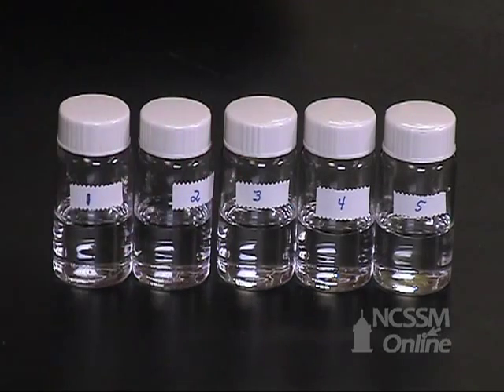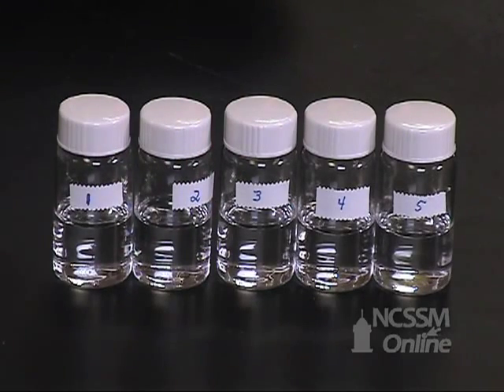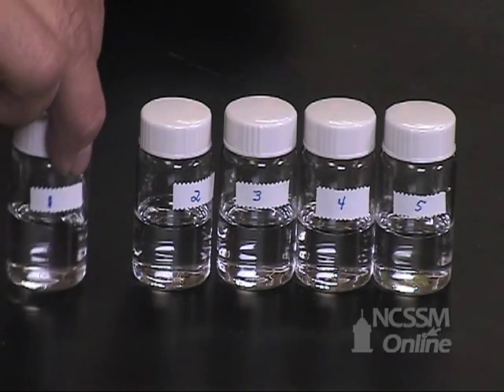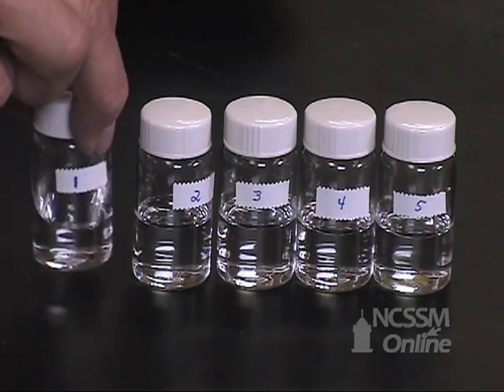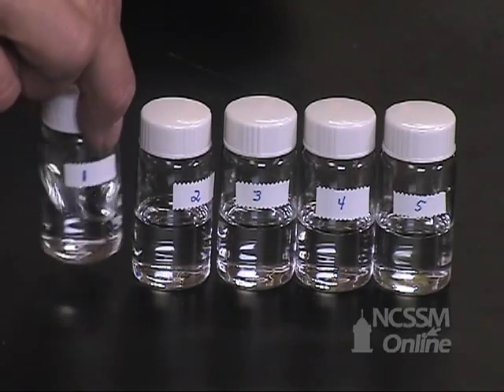We prepared samples with varying amounts of 3-molar HCl, water, and ethyl acetate. The total volume of all the samples has been held constant at 10 mL. Over the period of a couple of days, we will swirl the vials to make sure that the solutions stay homogeneous.